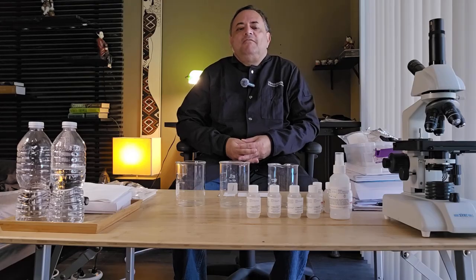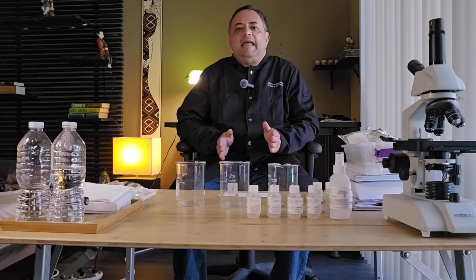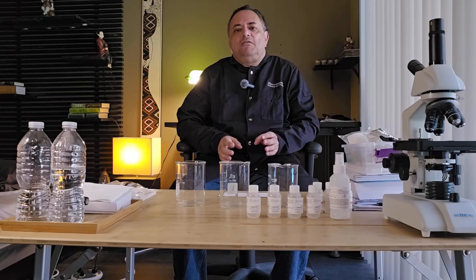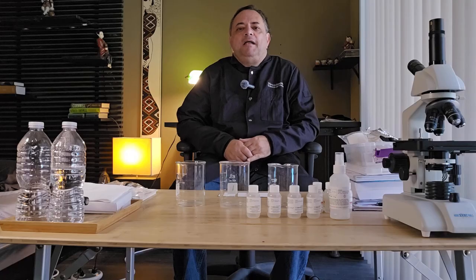Thin layer chromatography is similar to paper chromatography, and please check out my previous video where I introduced you to chromatography and demonstrated the simplest form of chromatography, paper chromatography, where I separated plant pigments.